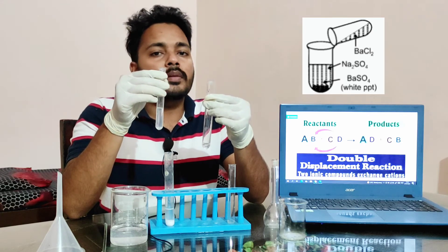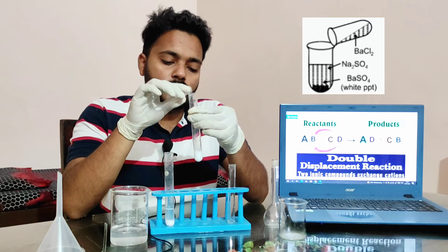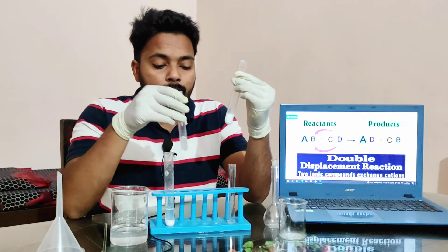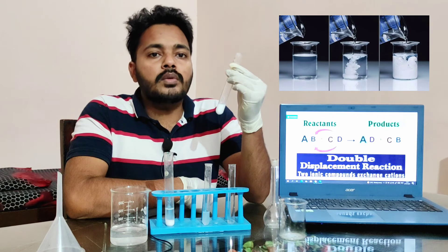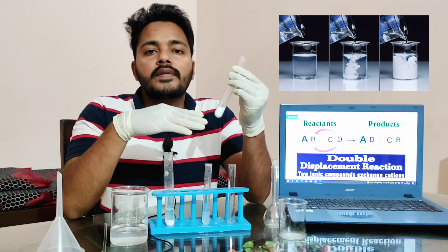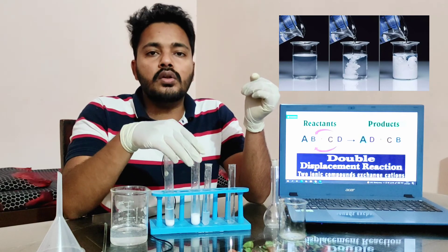Instantly, the precipitation will occur. Now, what we observe? The precipitation of barium sulfate is formed and sodium chloride is still dissolved in water. Keep the boiling tube at rest for some interval of time, and you will see there will be a separation of layers.